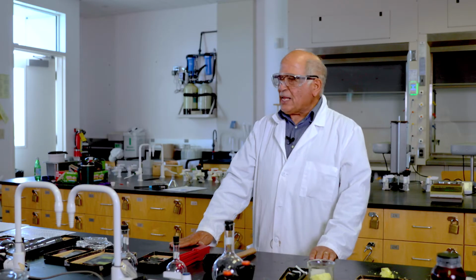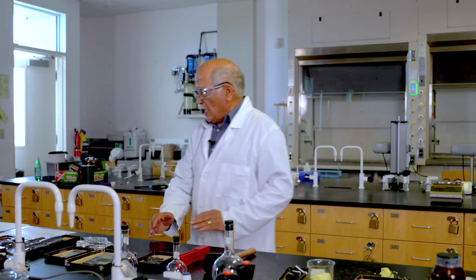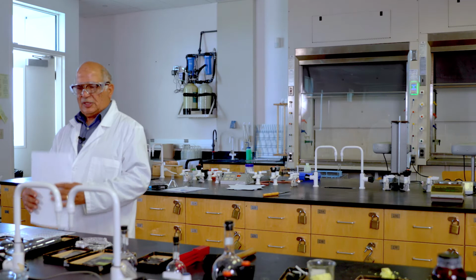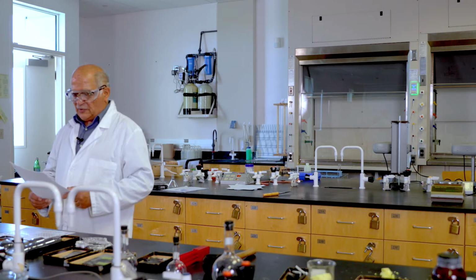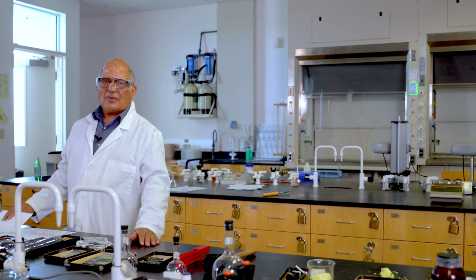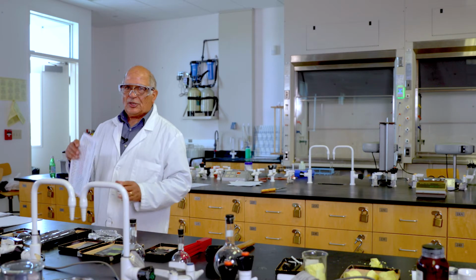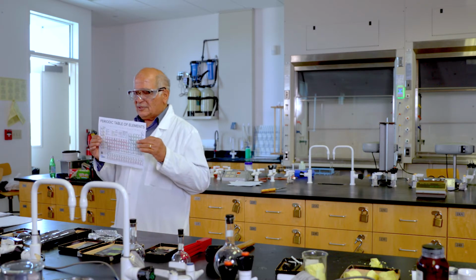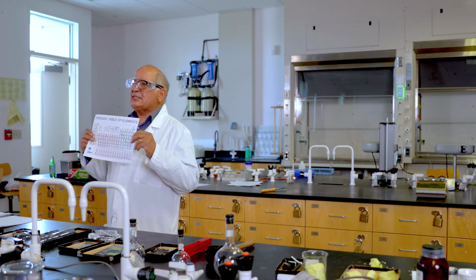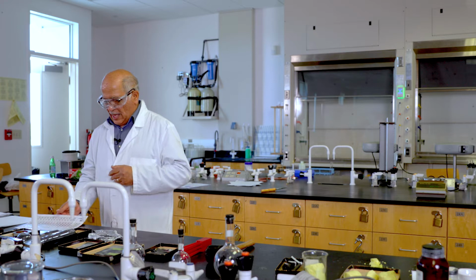Once again, please consult your textbook, Chapter 1, for definitions, as well as the lab manual, again for definitions. In this part of the experiment, you're going to examine some elements and compounds, mainly the elements. As you know, from this table of the elements, we have 118 elements. All have been found already. Now, here are the elements.